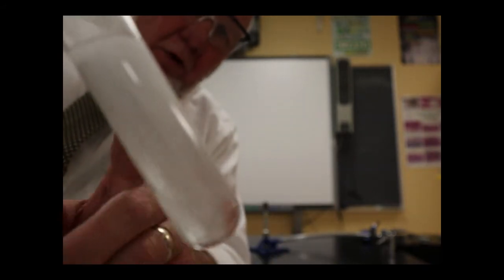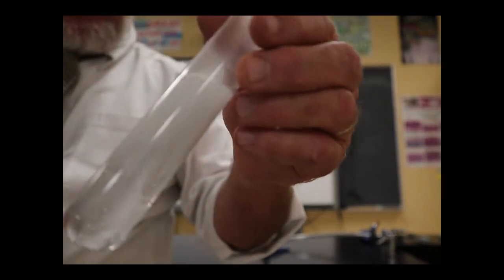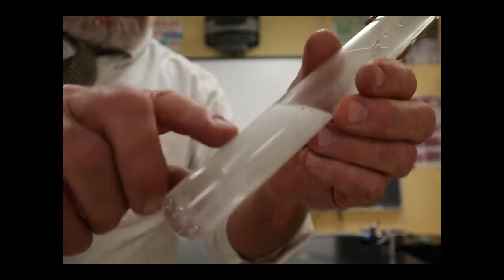Now, I'm using 30 milliliters of acid, which I think should be enough acid to react all of this magnesium. However, I'm not completely certain that the concentration that was on the bottle is accurate. I might have to use more hydrochloric acid. I want to make sure all of that magnesium reacts. And I don't really want to add too much more hydrochloric acid because what I want to do is once I get this all reacted and all the magnesium will have essentially dissolved. Well, we say it's dissolved, but it's actually changed chemically.